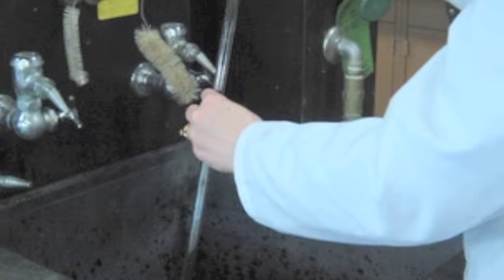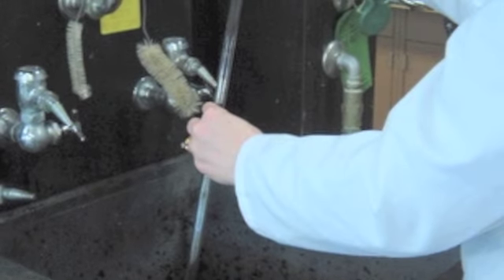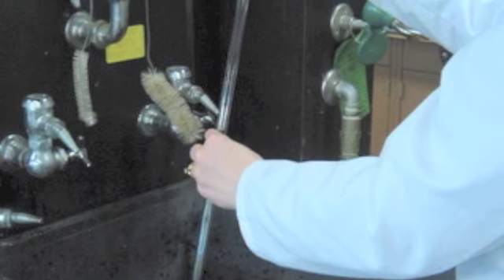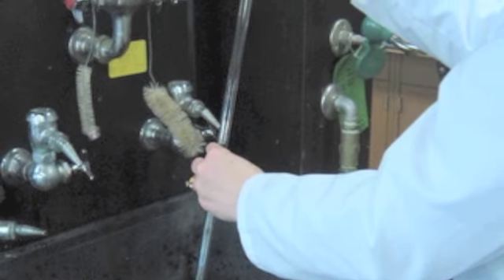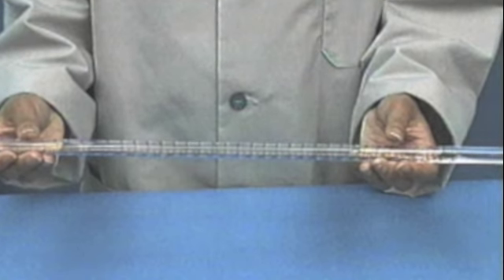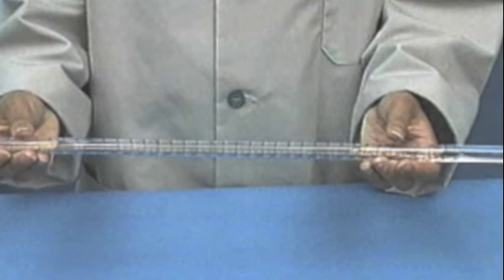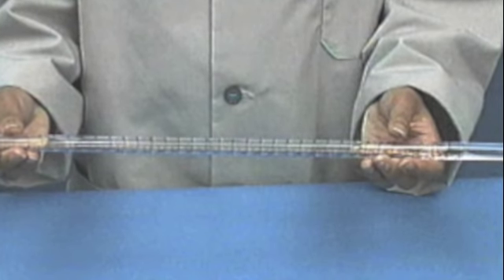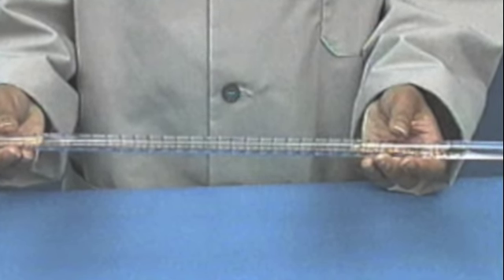An error that can occur before beginning the titration is not thoroughly rinsing the burette with NaOH. If the NaOH that will be used for the titration is added when there is still water in the burette, the NaOH solution will be diluted. This will require more NaOH to be added to the solution to reach the equivalence point, affecting the results the same way as over-titrating the solution.